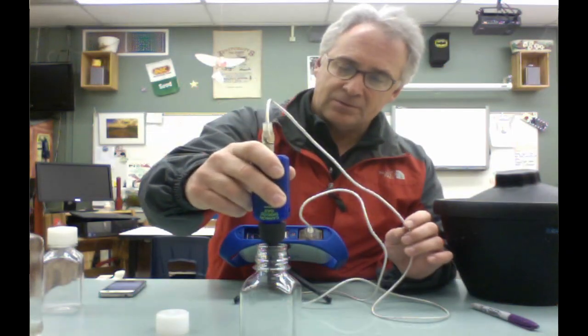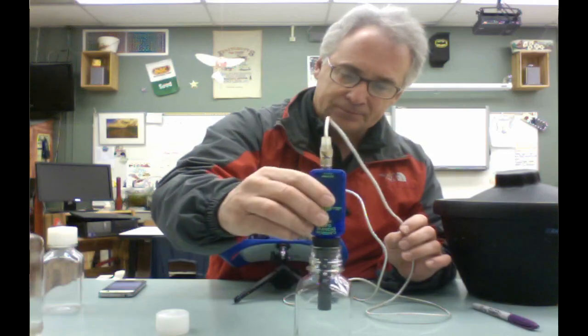And you're going to be collecting data for the seeds that have been soaking in water at room temperature for the last 24 hours. That soaking, is that going to help the process? Is it going to hinder it? And what kind of CO2 emissions is it going to have?